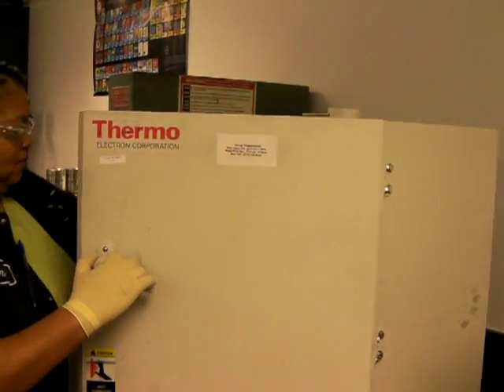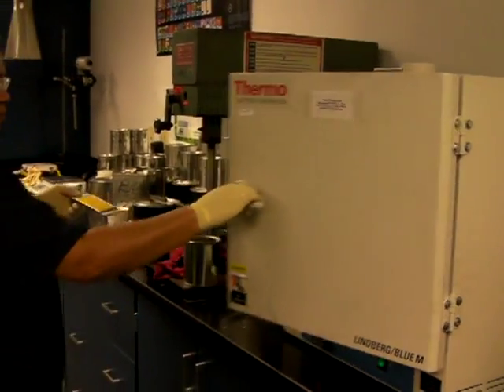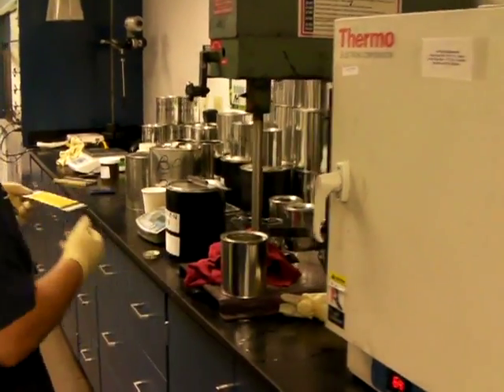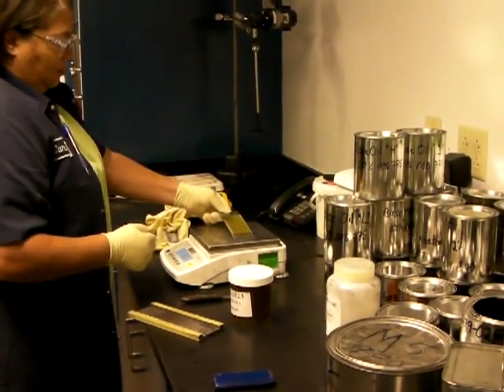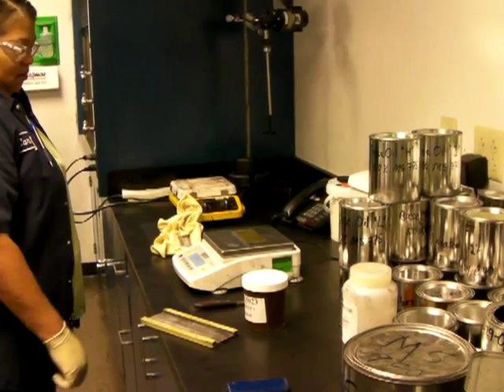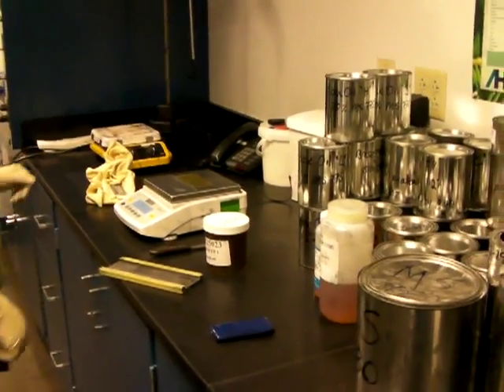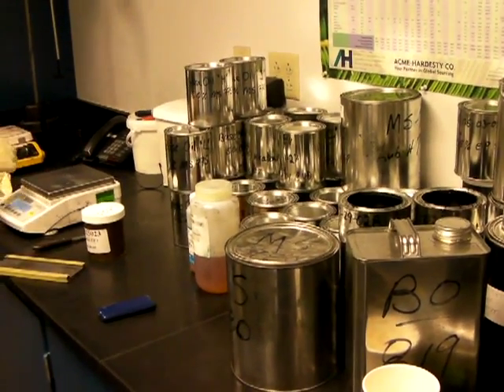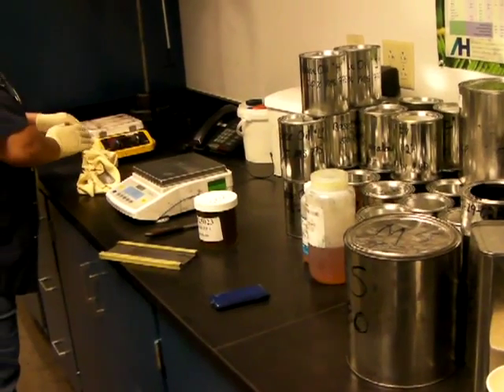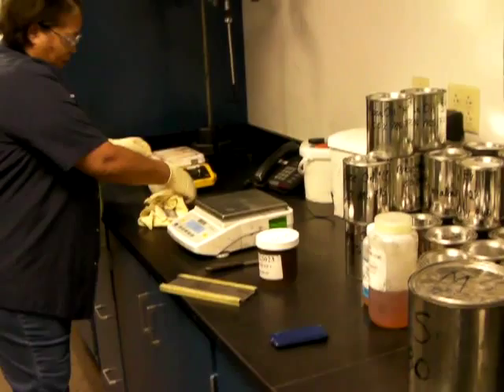It's been one hour in the oven. I'm just going to pull it out and weigh it. Simple as that. We've already weighed this and done the calculation. Kendra, what was the percentage loss? 1.69, 1.7. So, excellent result for this product. Thank you, Carmen. You're welcome.